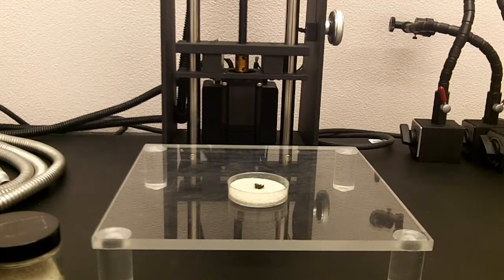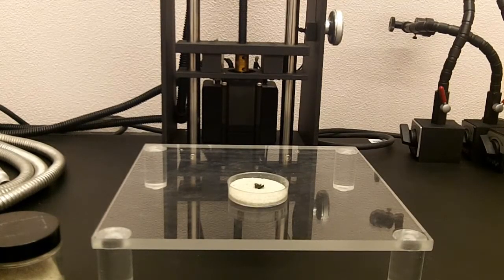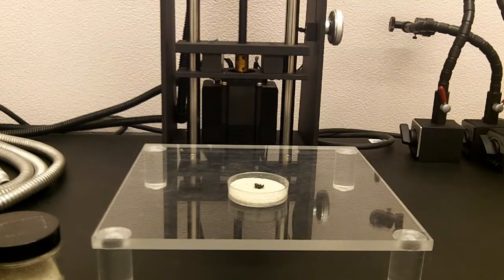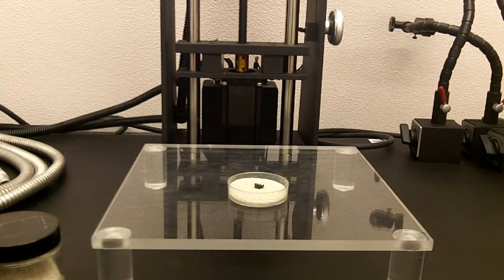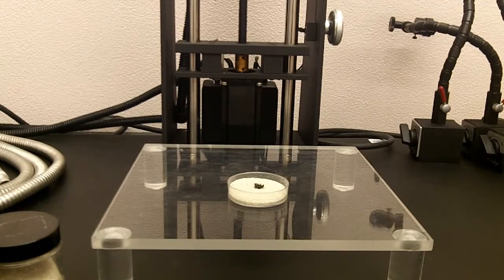This video will go over how to prepare a specimen that has been stored in ethanol to be imaged. There are several different techniques that you can do, and it's typically personal preference or the type of specimen you're working with.